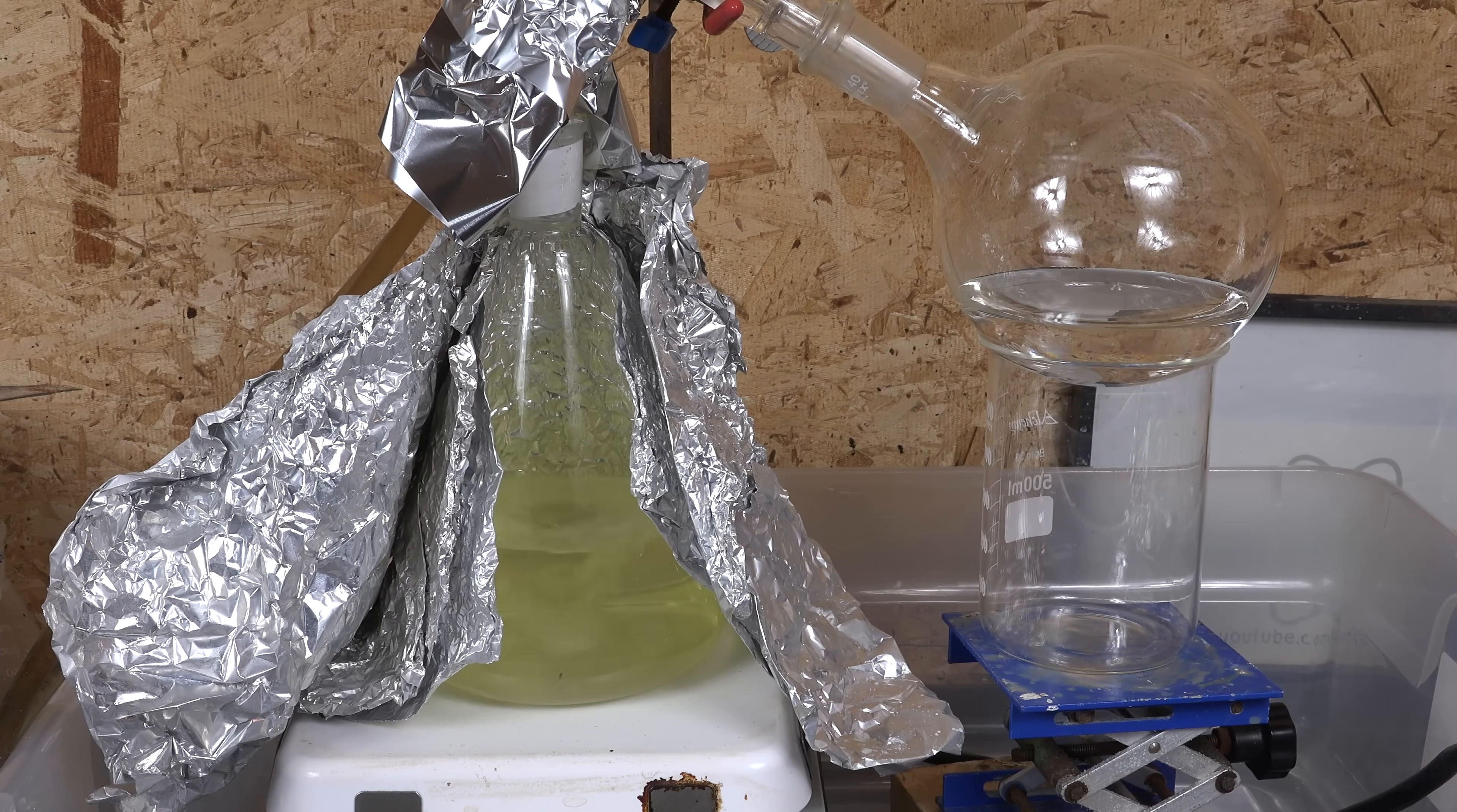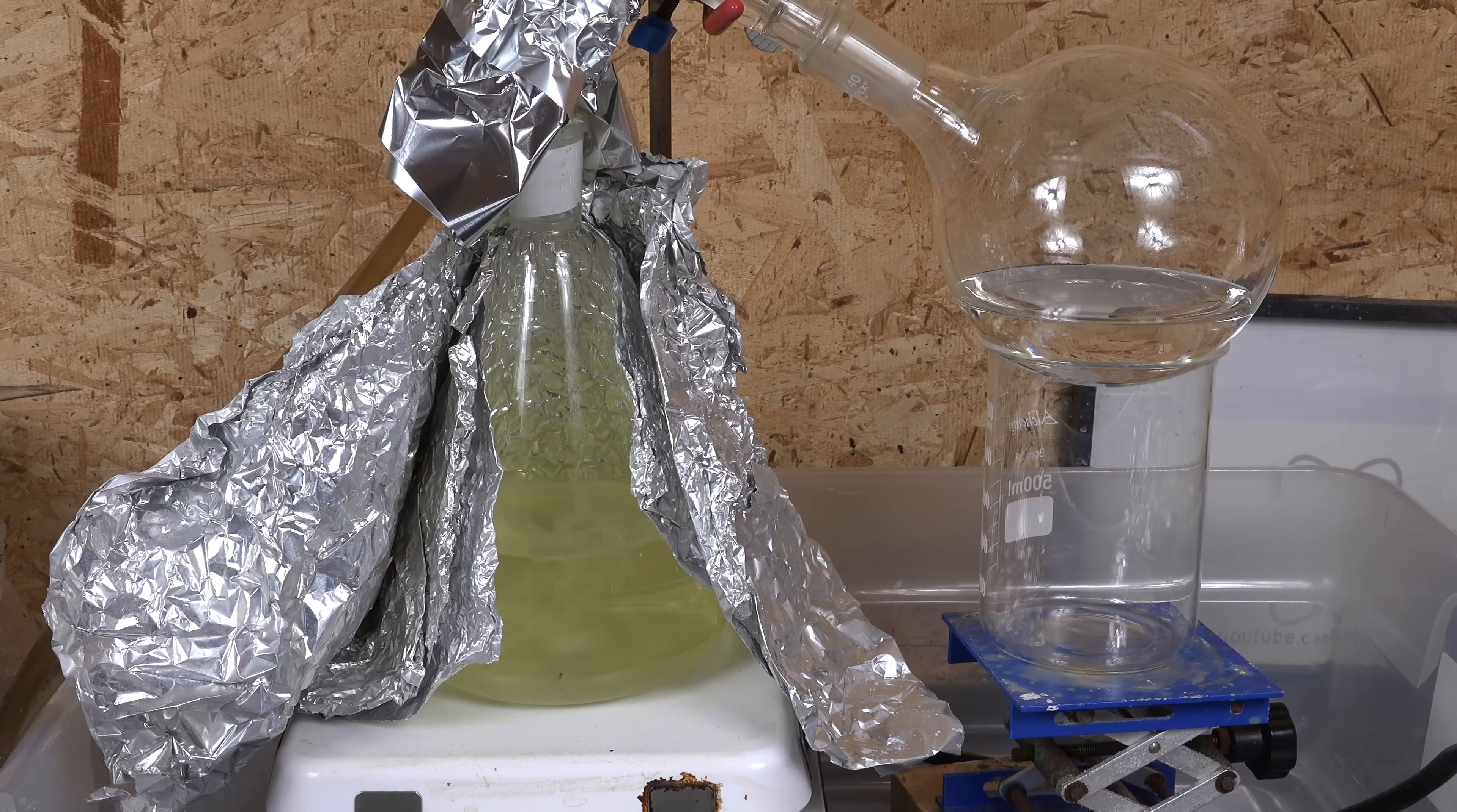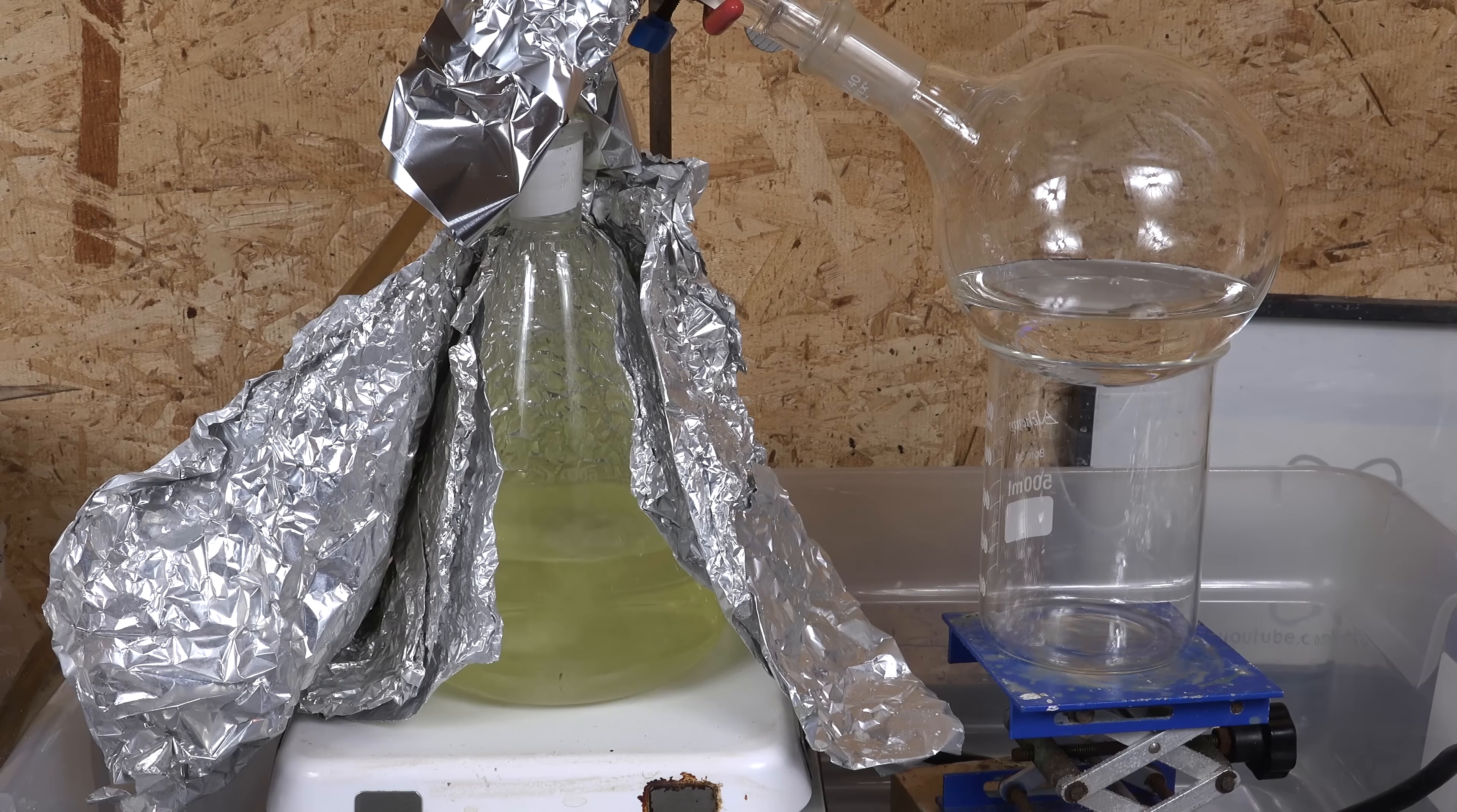If the acid has started a fire, extinguish the fire with a dry chemical fire extinguisher. I'm actually standing beside one while I'm doing this experiment. So what do you do when it's finally cold and ready to be cleaned up? Water and baking soda are usually used to neutralize and dilute it. But first look around to make sure the acid hasn't eaten through any electrical wiring. While PVC rubber insulation that most wiring has is resistant to cold sulfuric acid, it is not resistant to hot sulfuric acid. So be aware of that and cut power in the event of a major spill.